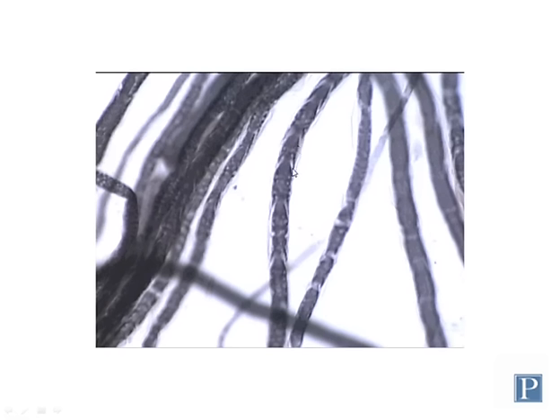These structures are called clefts of Schmidt-Lanterman, or you can call them incisures of Schmidt-Lanterman. Yes, you do need to be able to spell that. It sounds crazy, but if you break it down, it's not too bad. They're named after two German neuroanatomists, Schmidt and Lanterman. So it's Schmidt hyphenated Lanterman. You can read about it in your lab manual to get the spelling down. You are responsible for being able to distinguish between clefts of Schmidt-Lanterman and nodes of Ranvier.